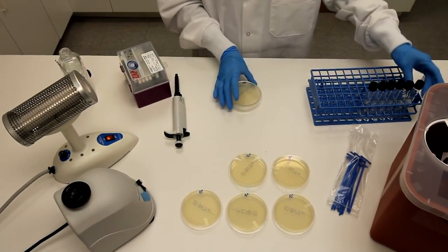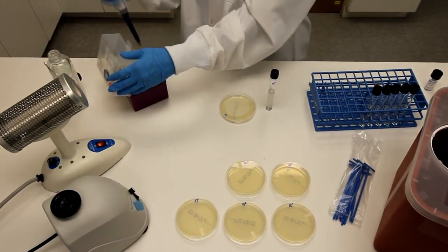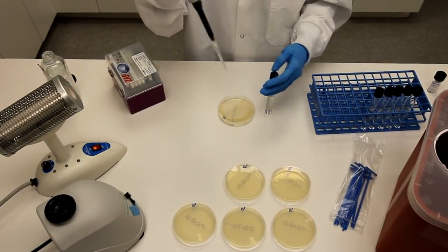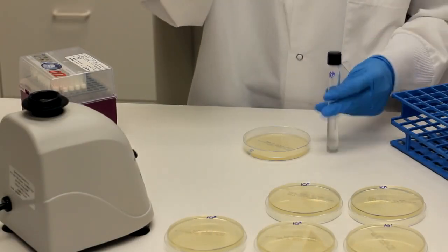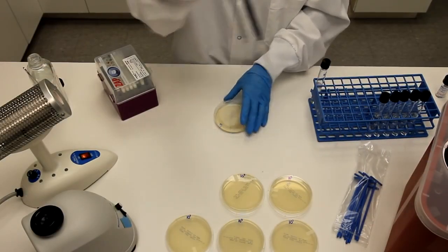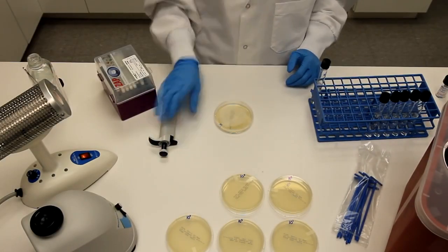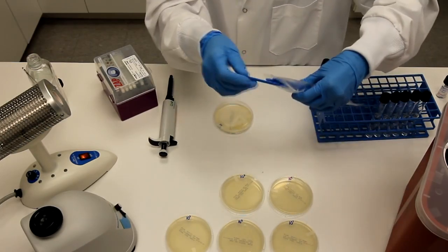Plate one milliliter from each tube. Use a spreader to distribute the inoculum evenly.